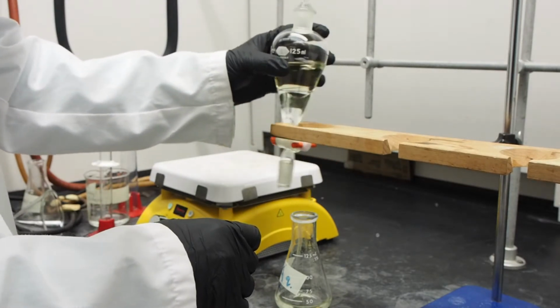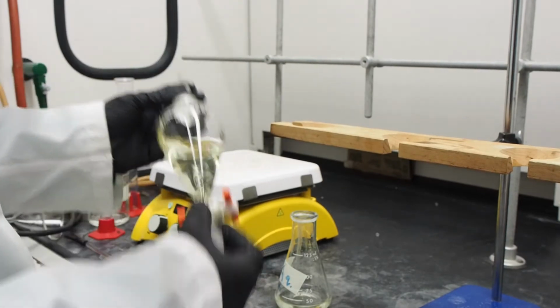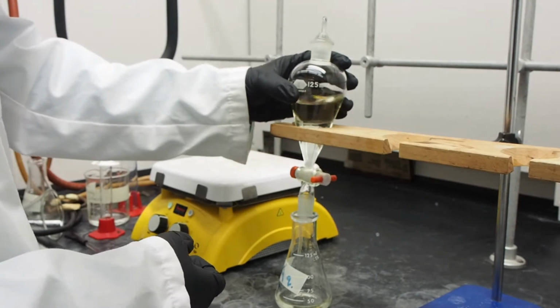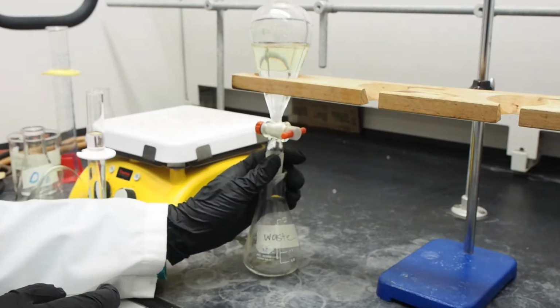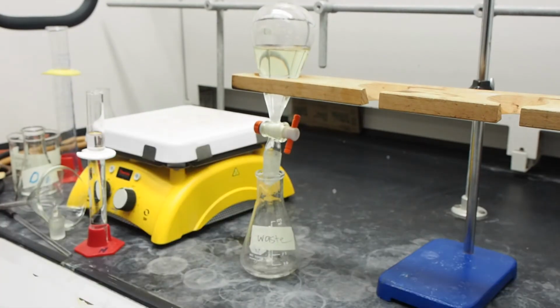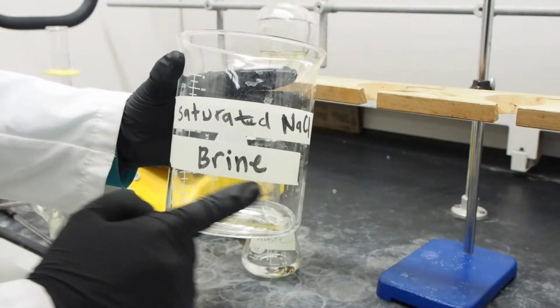Now our compounds are separated. Benzoic acid was completely transferred to the aqueous phase in the form of sodium benzoate. Add water to the separatory funnel, shake, then release pressure. It will wash away the remaining sodium hydroxide. Drain the bottom layer to the flask labeled waste.